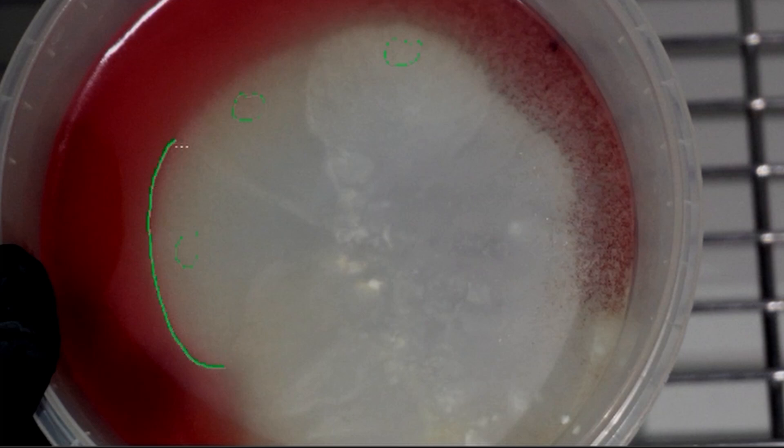I'm just taking a small cut from the leading section, not the very edge but just behind the very edge. I totally ignore this bit along the bottom because that's a zone of chaos. There's no symmetry there and I'm not really sure what I'm cutting away. But these radial fans along the top, you can clearly see is clean mycelium, so that's where I'm taking the cuts from. Not the very edge, but just behind the edge.